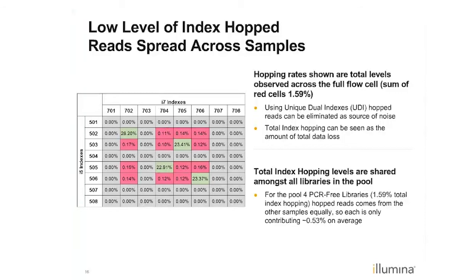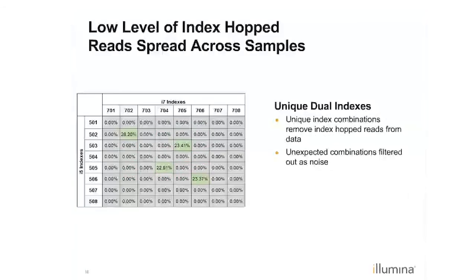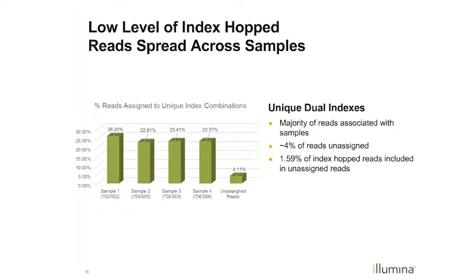But one important thing to keep in mind is that if you use unique dual indexing, essentially what you're doing is eliminating those red or pink boxes from the analysis. And so the unique dual combinations allow you, as part of the demultiplexing process, to remove these unexpected combinations and filter them out, and they just become part of the filtering noise of doing an NGS experiment.